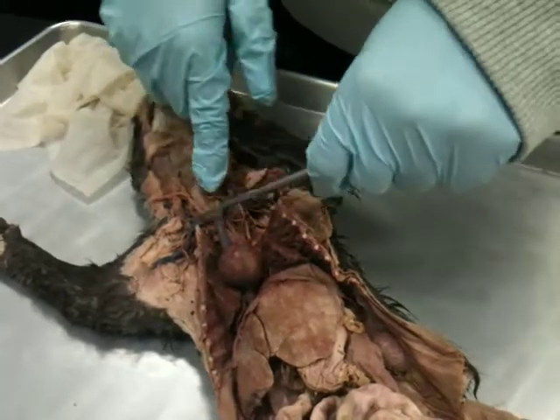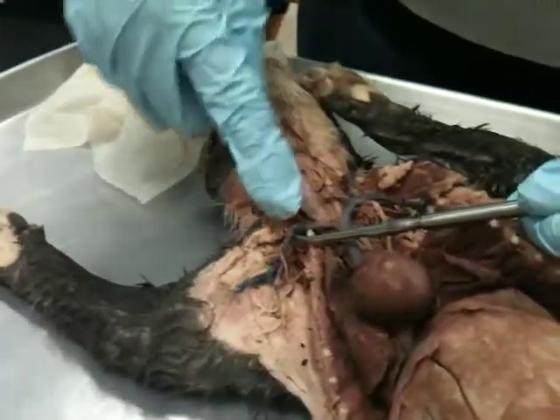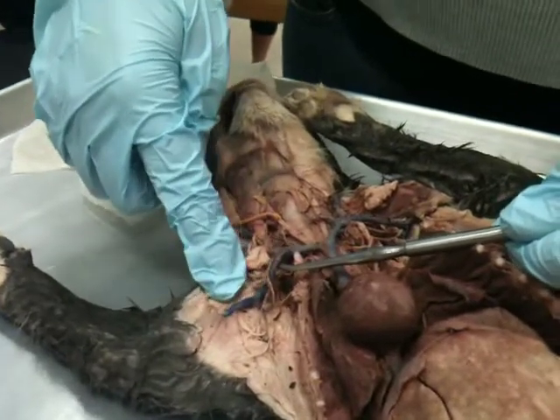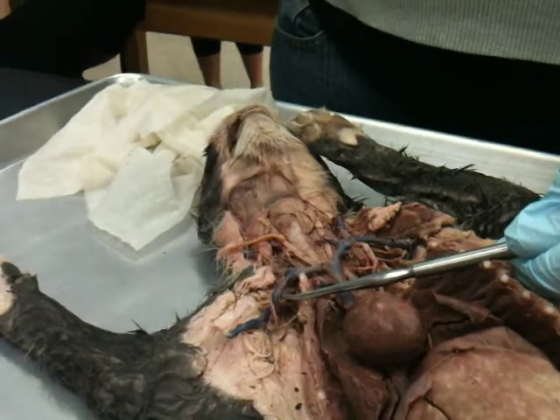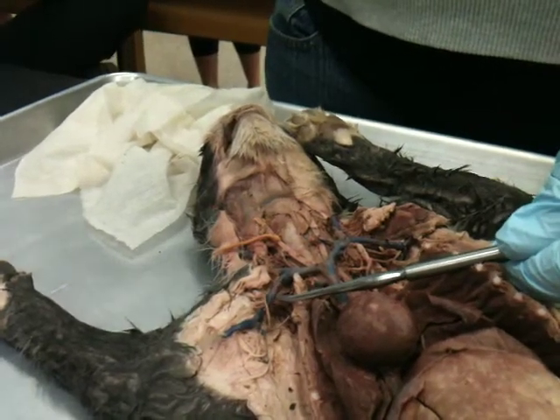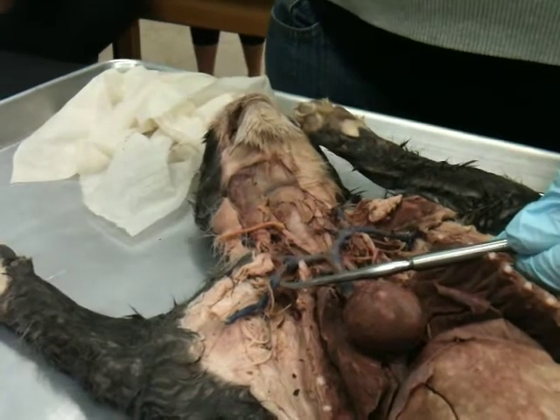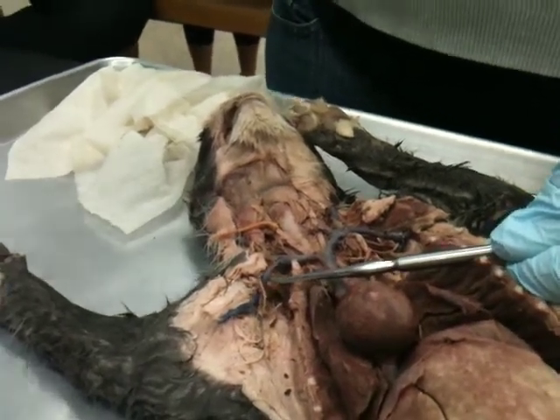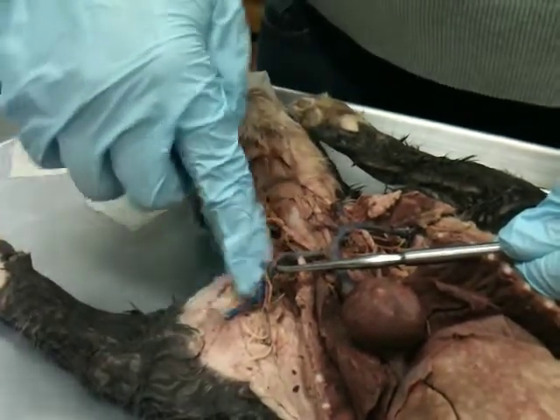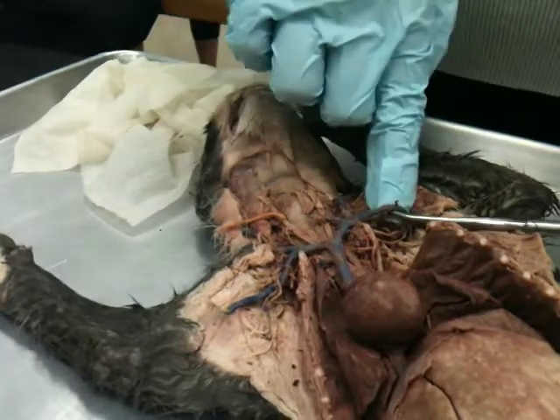Okay? So these two branches off of the brachiocephalic vein, the one going into the arm, what do you think it's called? This is subclavian? Subclavian. Yeah. Right, so this one, in this case, is telling you what it's doing. It's underneath the clavicle going towards the arm. Okay, so sub, below, clavian refers to clavicle. So you have the right subclavian, and then again this is a mirror image, so you have the left subclavian.